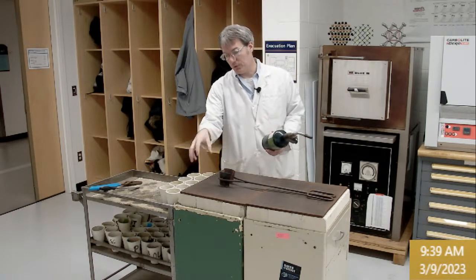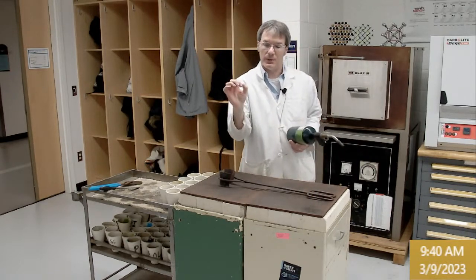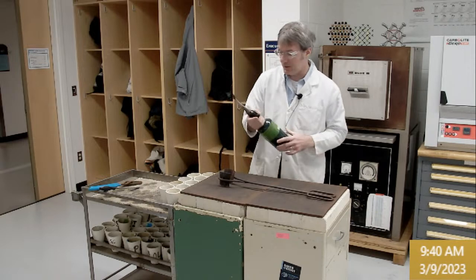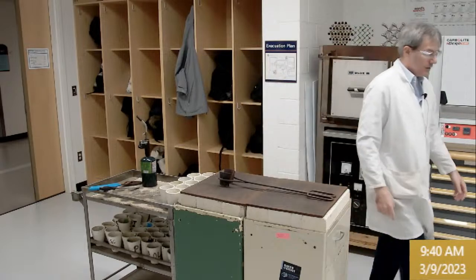And then once I pull the crucible to set here, you will fire polish that surface so that the defect from the glass strand will pull into the glass and make a nice disc. So that's a job that's probably the most active of the whole set if you wanted to try that.